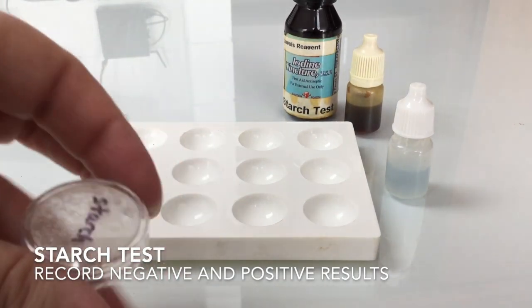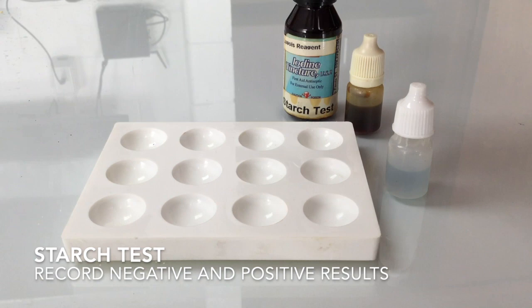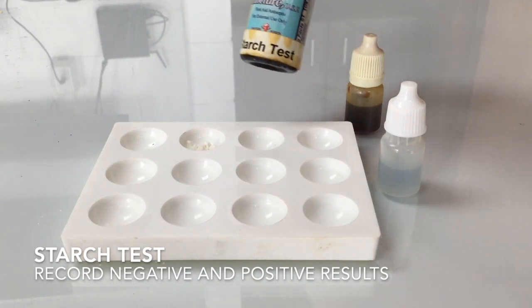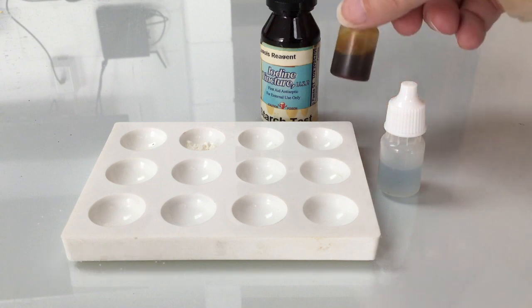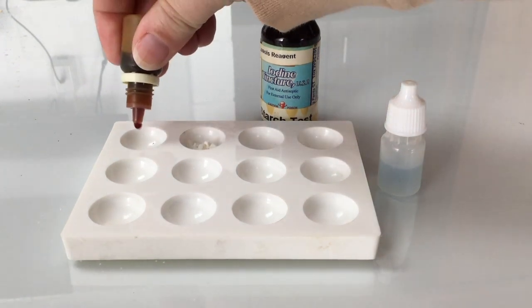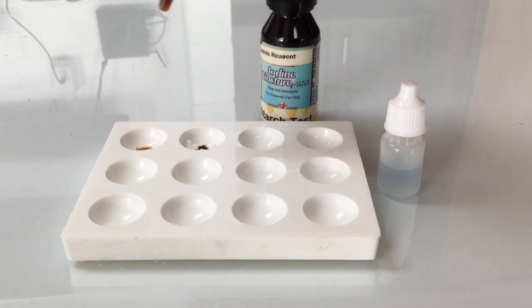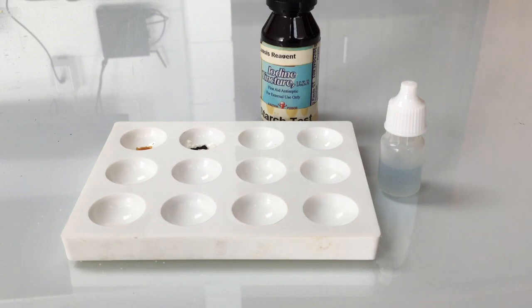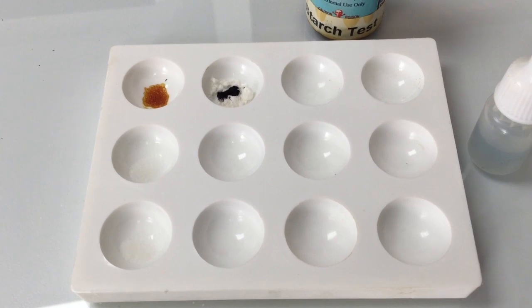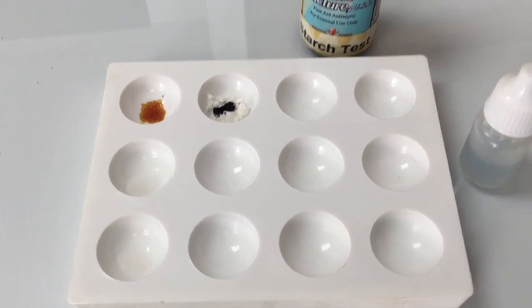We will start by putting starch into the first row, and starch will be tested by using iodine. So you can see the bottle that says starch test. We have a small amount of the iodine in the smaller bottle, which we will use. So what you want to do is observe what happens when we put it in the salt, which will be a negative test, and what happens when we put it into the starch. What is the difference in how the negative and positive test appear? You might want to stop here to record your observations.